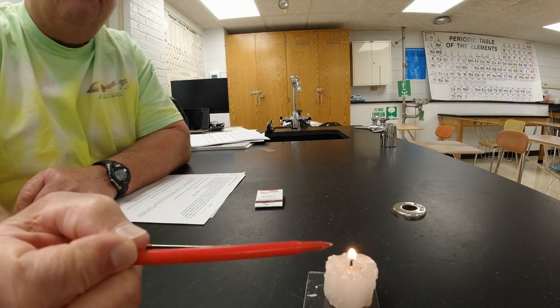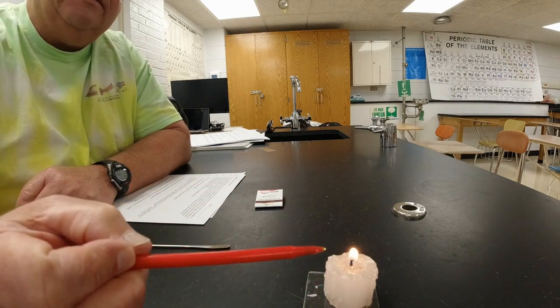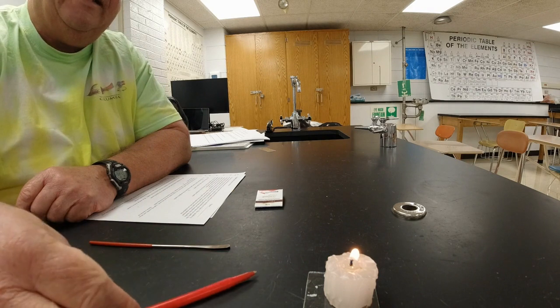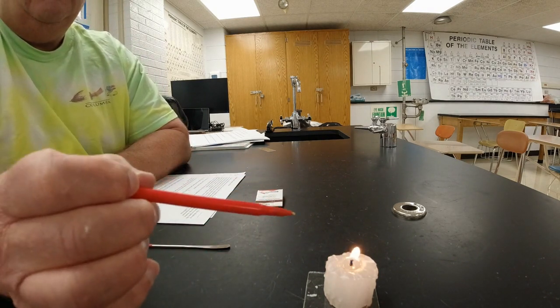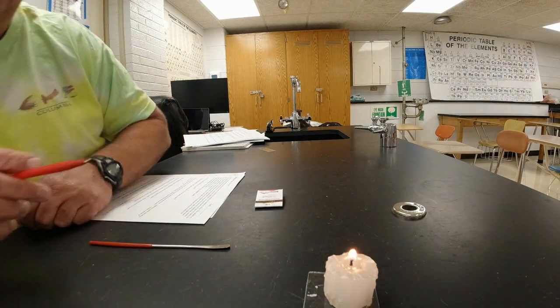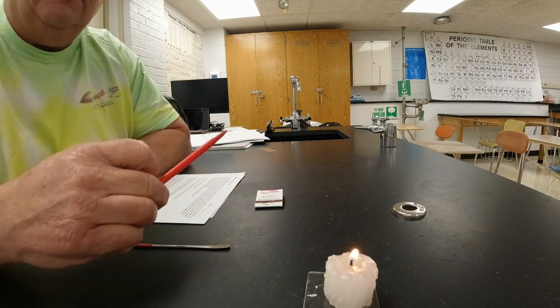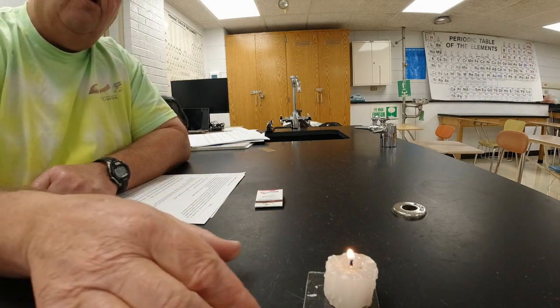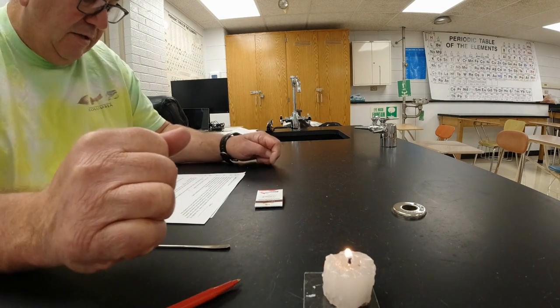And if we let this thing burn long enough, we're probably going to get some dribbles of liquid wax over the side. You can kind of see some of the old ones that are on there, like that. But again, there's our flame, and it's on the wick. It doesn't seem to scatter to any other parts of the candle. It seems to be only on the wick, but it certainly started to burn a little bit brighter when we got a little more liquid wax. All right, so that's part 2.